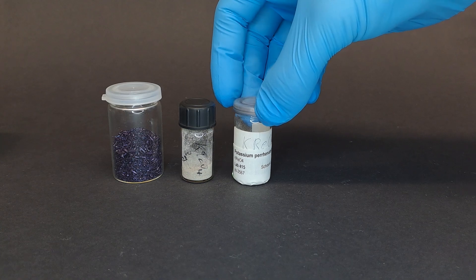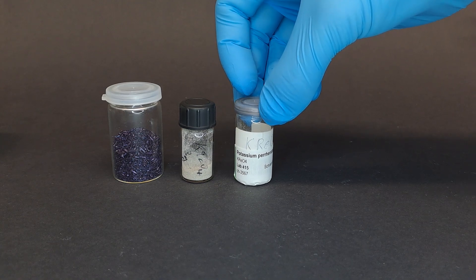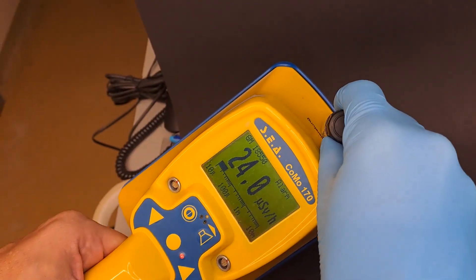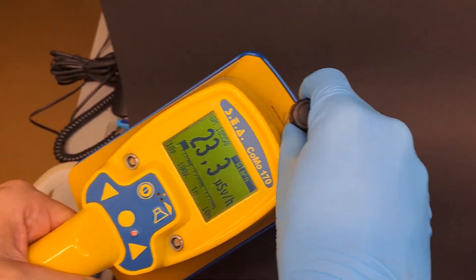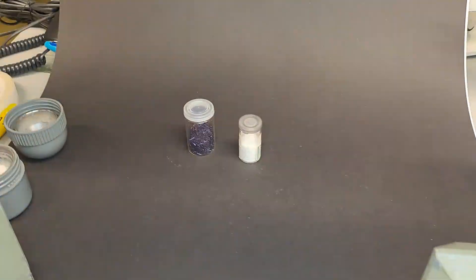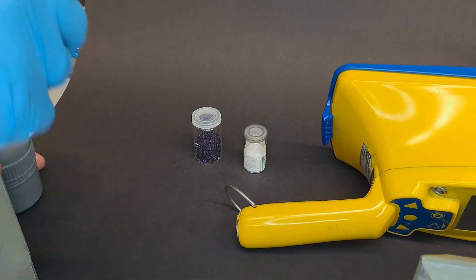Of course, we need to measure the dose rate for the pertechnetate. It is 23.4 microsieverts an hour, and 0.1 microsieverts an hour inside of the container.